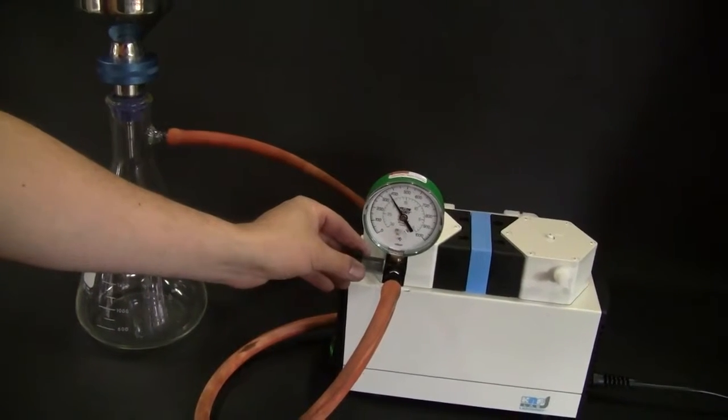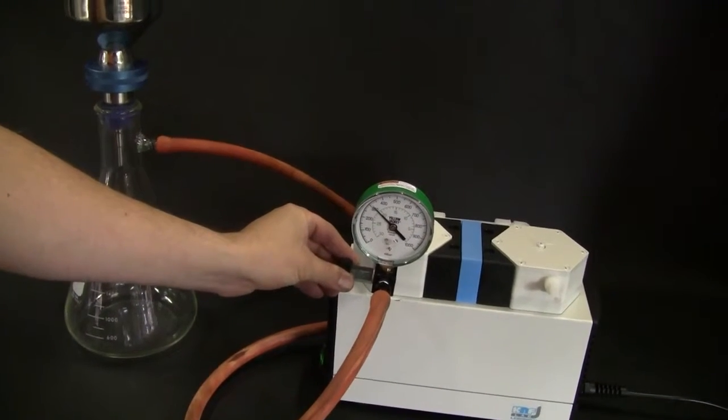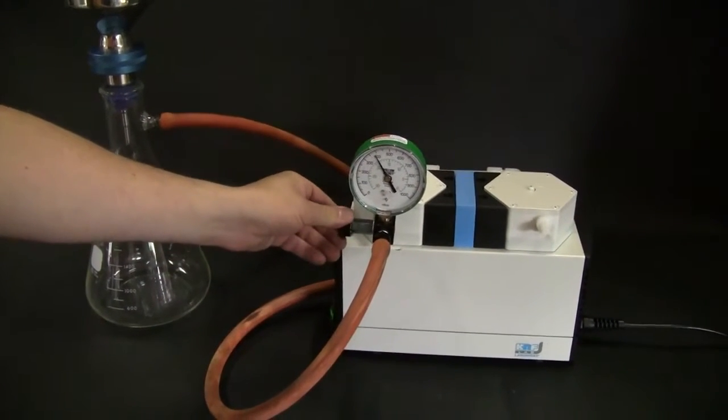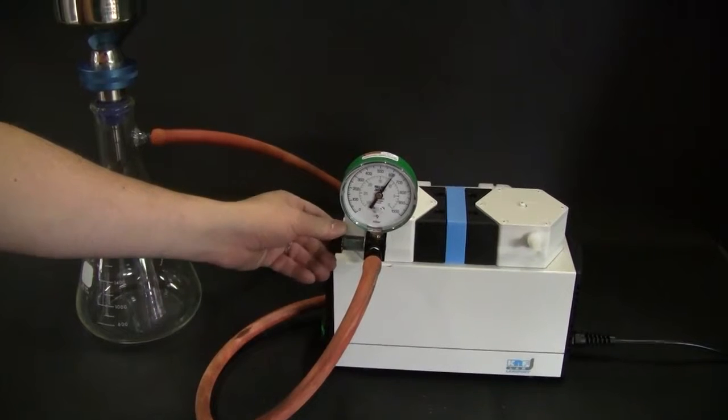I can pull it down to full vacuum. I can adjust it to 300, or just put a tad on it.